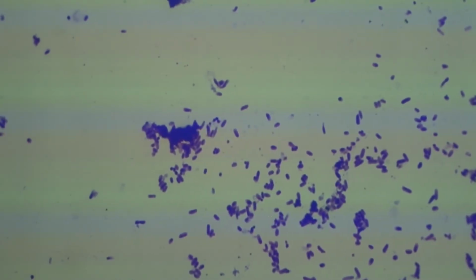On the other half of the slide, fine focus, and now all of a sudden what do I have? I don't have cocci, I actually have short rods. These short rods, some of which look like little eggs, they're almost cocci, but they're known as coccobacilli. These are actually E. coli. E. coli, it's debatable whether you want to call it a short rod or a coccobacillus.